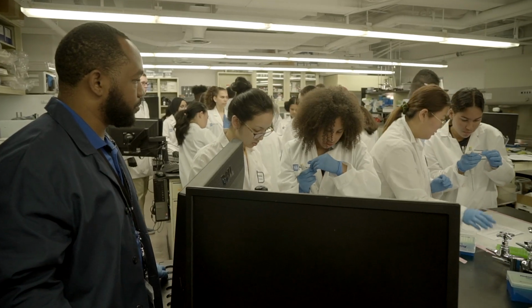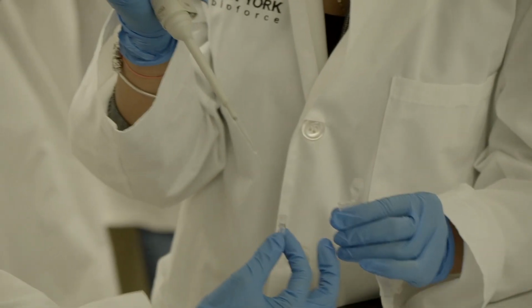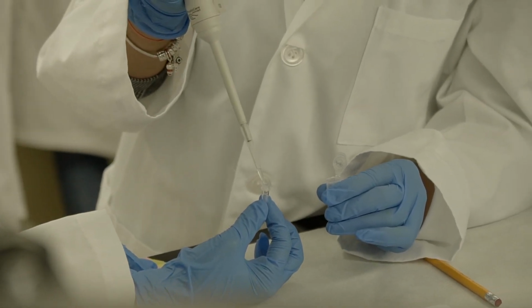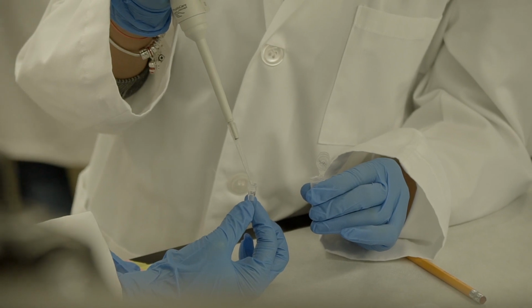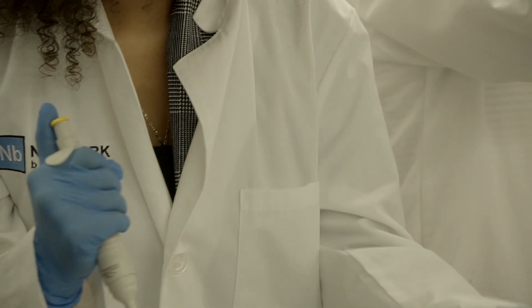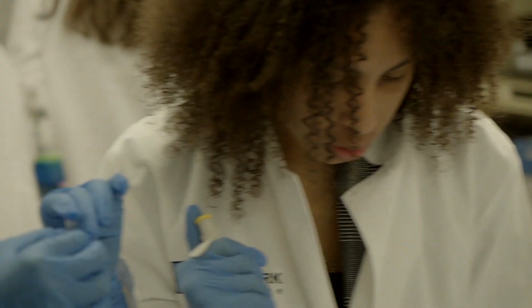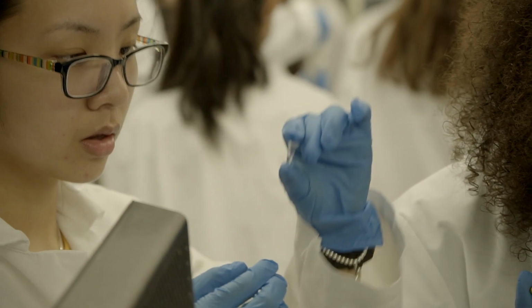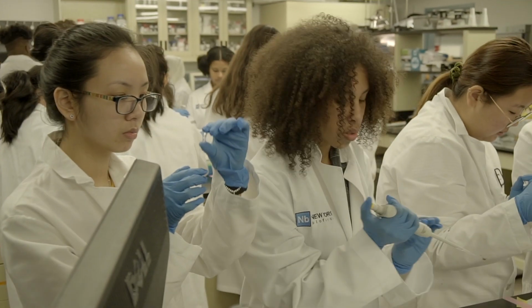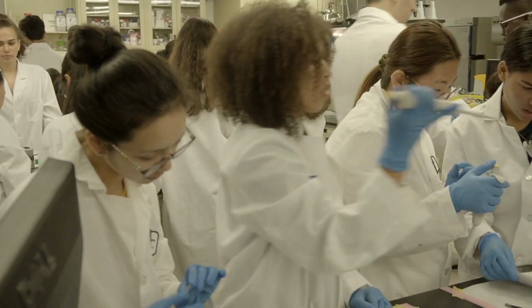It's not just RNAs. We use the term RNases and DNases. Does anyone have an idea what that is? Yeah, an ase is an enzyme. The ase part usually indicates that it's cutting up whatever it's acting on. We don't want RNases and DNases floating around our system, so molecular grade water gets rid of that from our system.